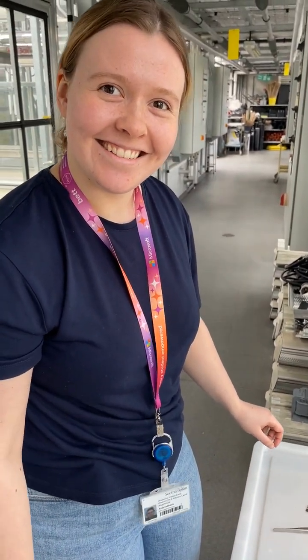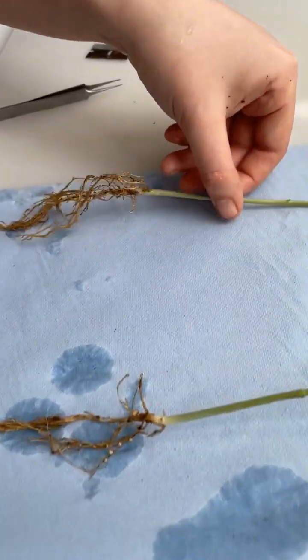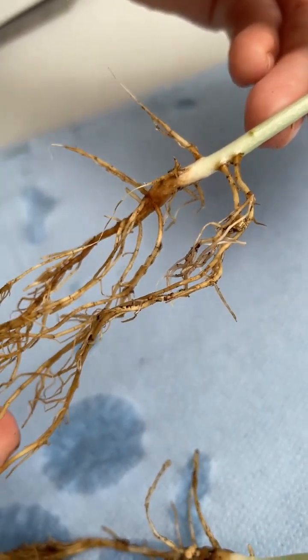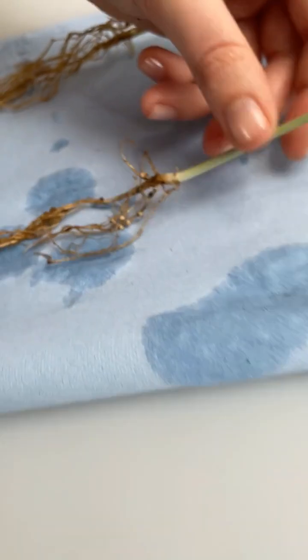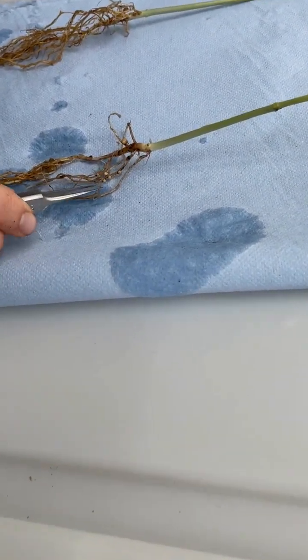Okay Anastasia, so you've washed the plants, so what have we got? So we've got two different plants here. One of them has no nodules — okay, and that's okay. The other one does have nodules. I see them, okay. So let's have a look inside one of them, because if they're active, they should be really pink on the inside.